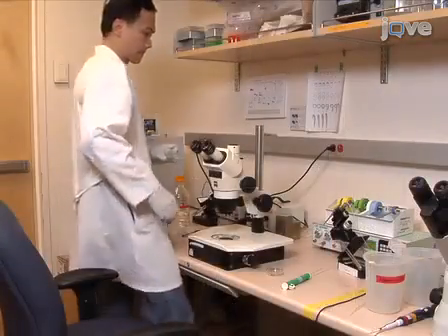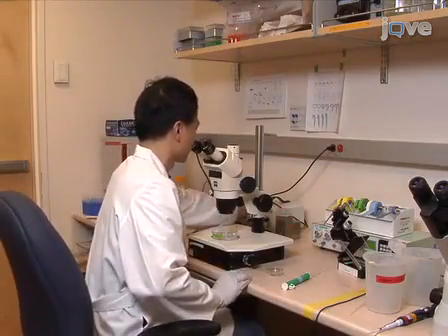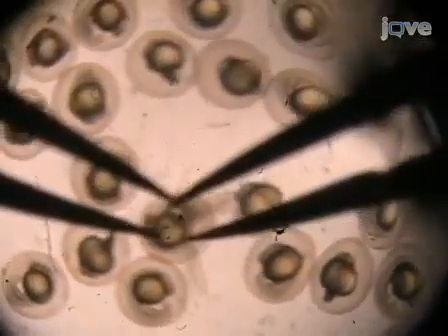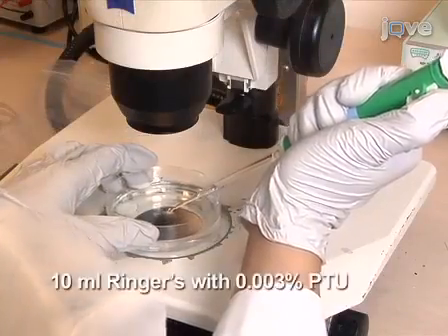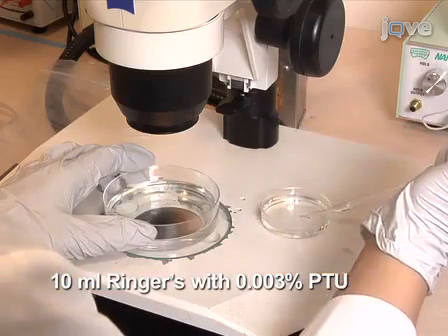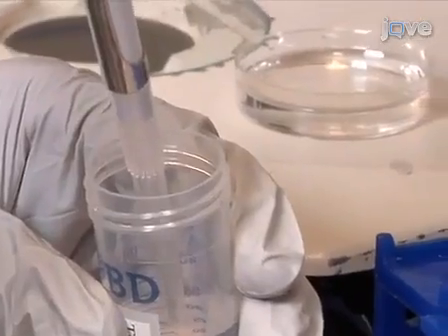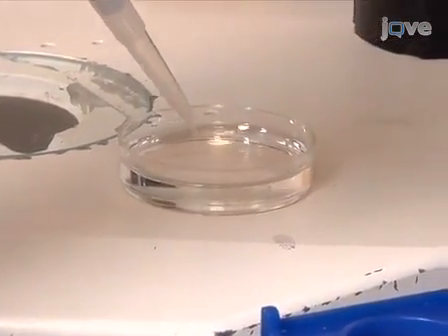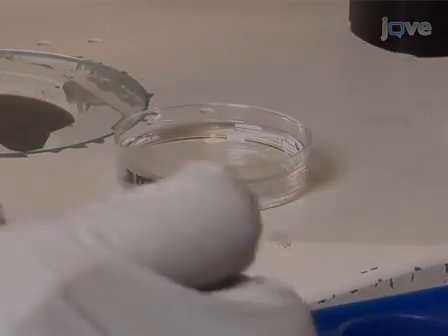The following day, at 22 hours post-fertilization, the embryos are ready to be electroporated. Begin by dechorionating the embryos manually with fine forceps. Transfer the dechorionated embryos into 10 milliliters of electroporation ringer solution containing PTU. Then, to anesthetize the embryos, add 420 microliters of tricaine stock at a concentration of 4 mg per milliliter to the solution. The embryos are now ready for electroporation.